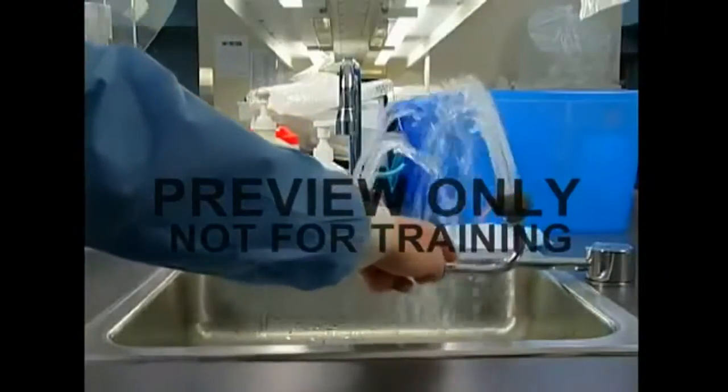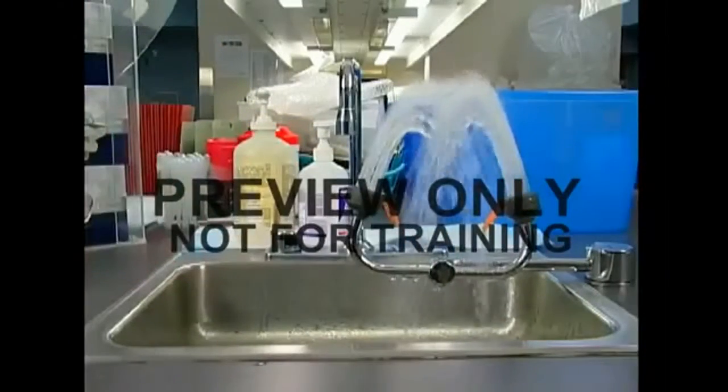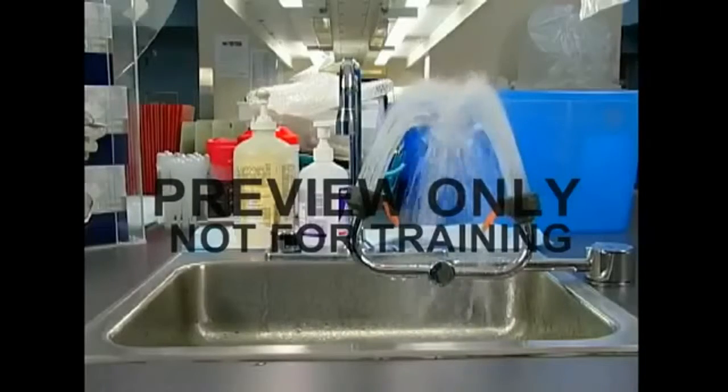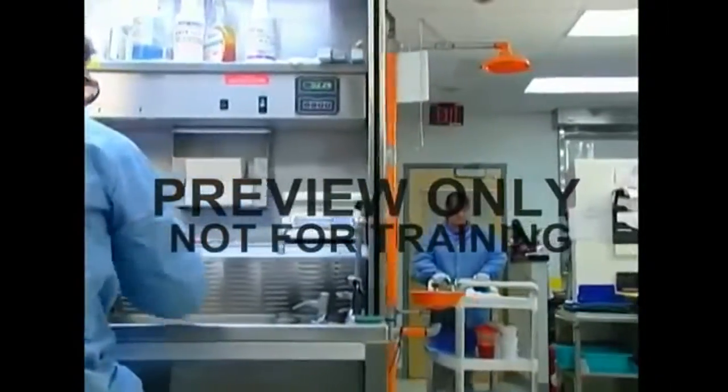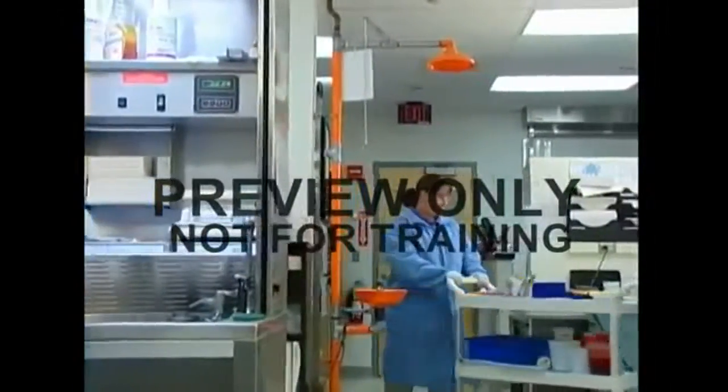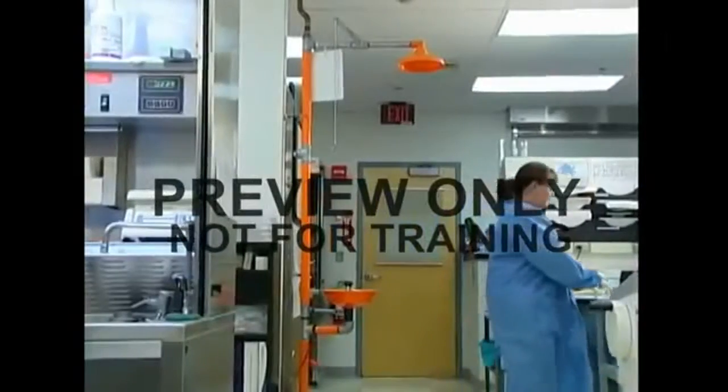Eye washes need to produce a soft stream or spray of aerated water. This should also last for at least 15 minutes. Showers and eye washes should be located wherever corrosive, infectious, or other hazardous substances exist.